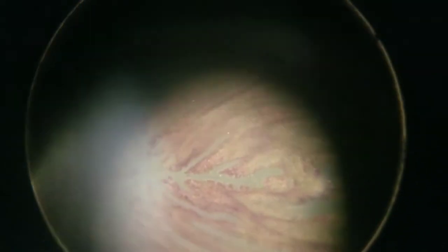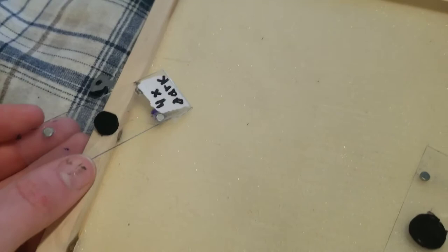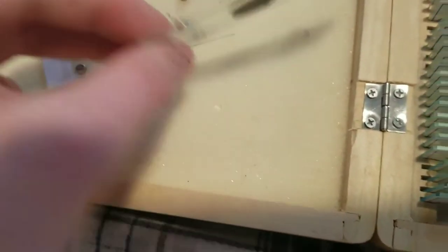Try 10x dark field. Really see that awesome pop. I really fine-tuned this and tried out so many different circle sizes until I found the right one, because I didn't really do as much research with the 4x dark field. Since it only goes up to 64x with the 4x objectives, I would never use it for bacteria, so I didn't fine-tune it. With the 10x one, I tried out so many different size circles to try to get it perfected.